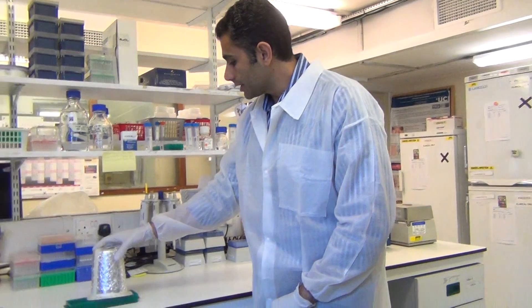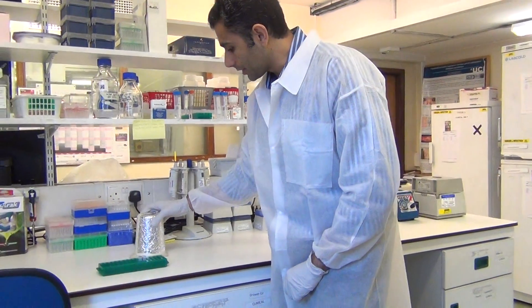The labeled products are then ethanol precipitated. An indication of successful labeling is a distinctive purple colored pellet, as you can see here.